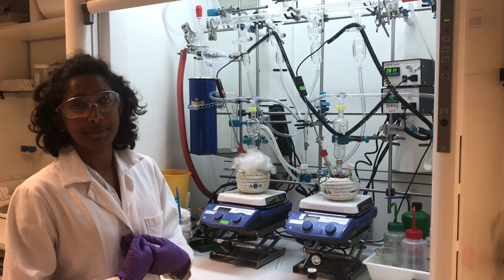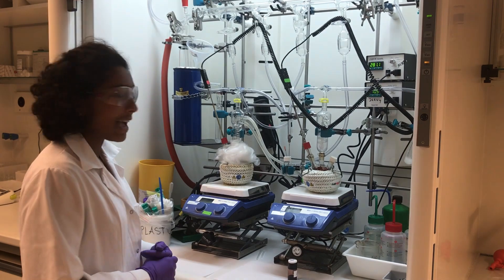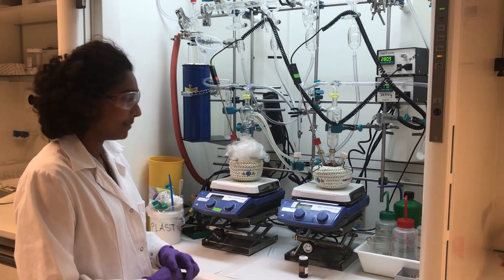I'm a second year PhD student, Chetna, working in LNCE, and now I'll be showing you colloidal chemistry and how it's done.